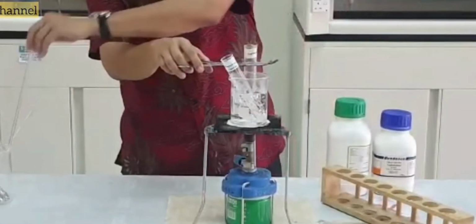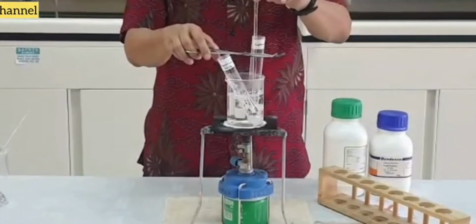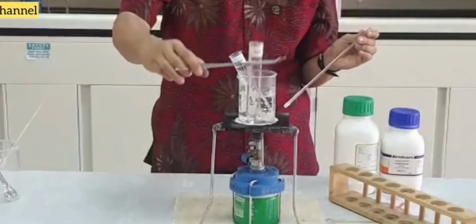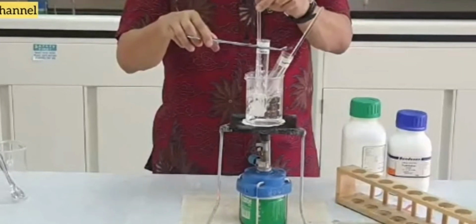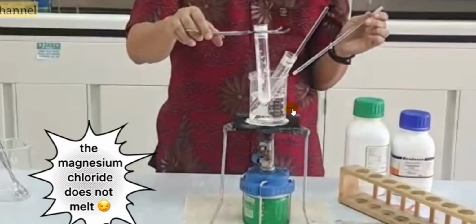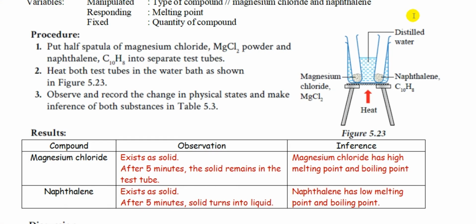While waiting, you can also stir the compound, especially the naphthalene. Look at the naphthalene now, 溶了，看到吗？Magnesium chloride: stir it for a few seconds. And now look, magnesium chloride does not melt. What does this mean? Talk to your teacher to find out. Thank you and have fun.